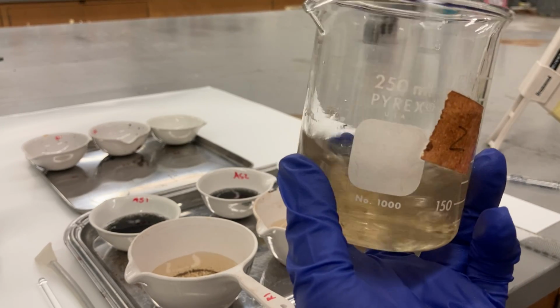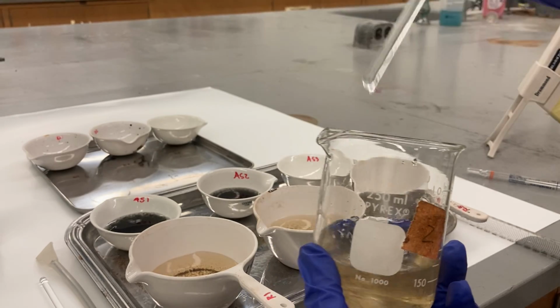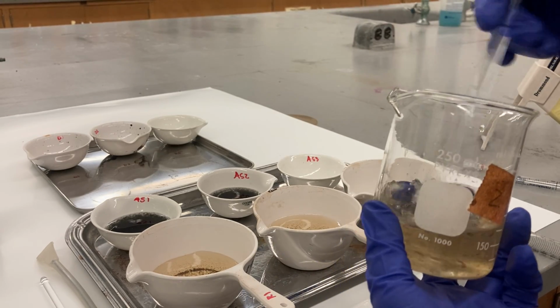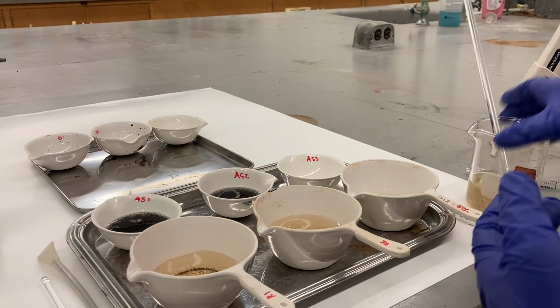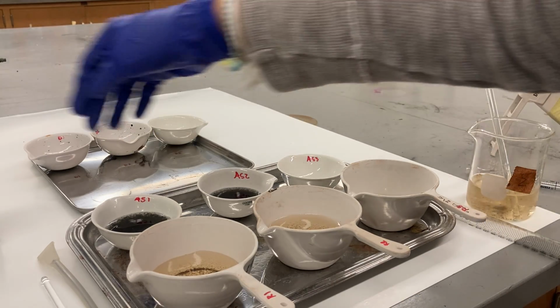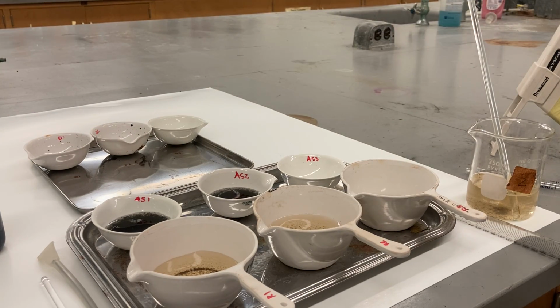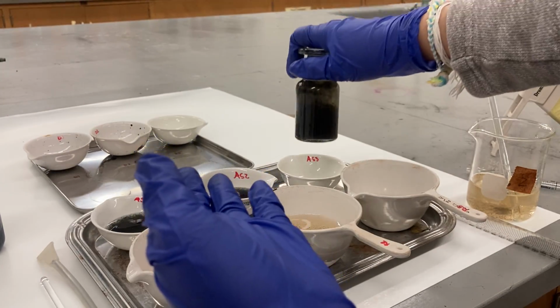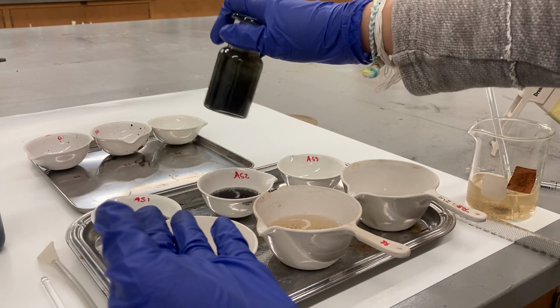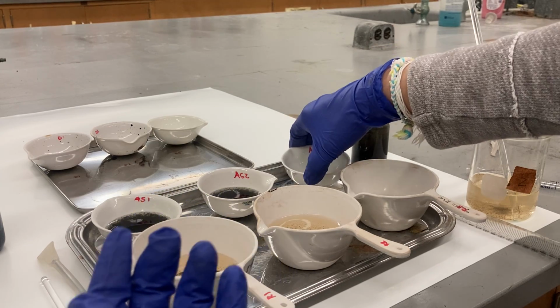the sample I mix it all. I pipette 50, I put it in here, then I mix it and pipette 50 and I put it in here, and I'm gonna mix it and pipette 50 in here. Now for the mixed liquor, for the wastewater sample, where's my wastewater? For the wastewater sample, I pipette 20 into each of them, 20, mix it, 20 into here, 20 into here. I'm gonna show you just the last one.